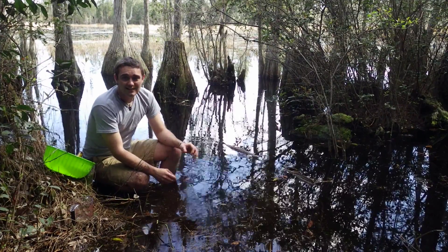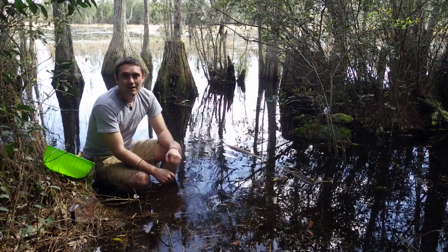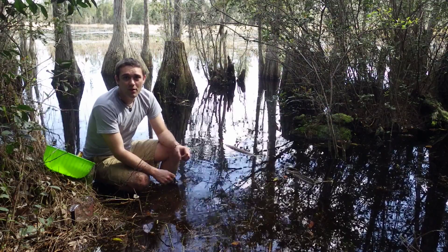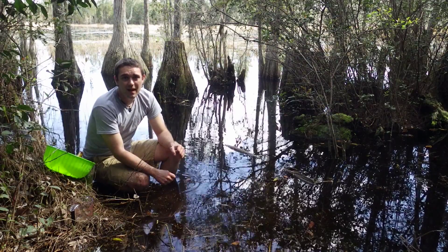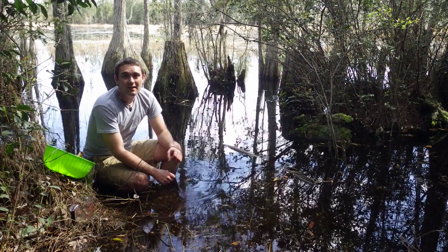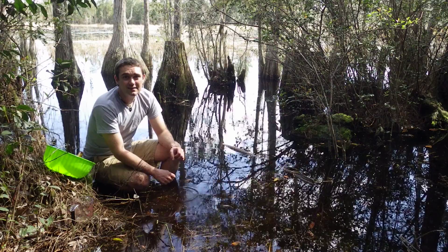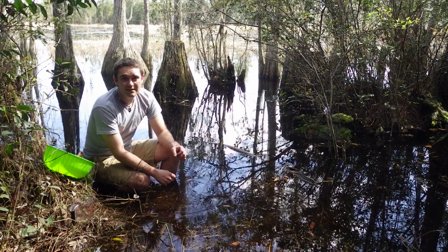Today we're going to be building a Winogradsky column. A Winogradsky column is a microbial community of bacteria that was developed by Russian scientist Sergei Winogradsky.